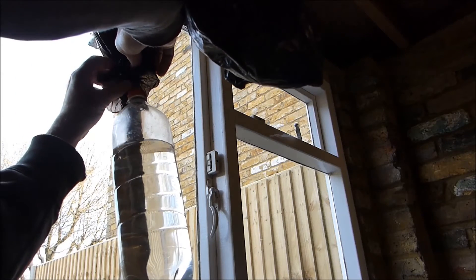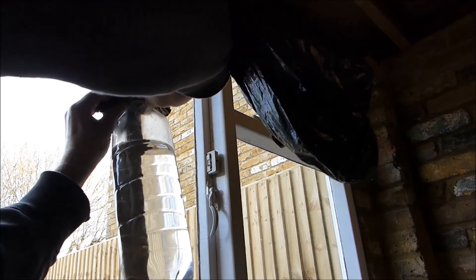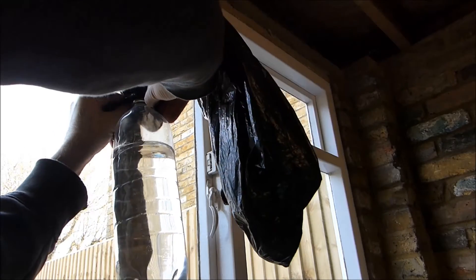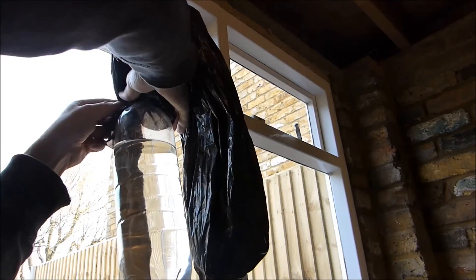Once the storage bottle is full, the excess hydrogen bubbles up through the top expansion bottle. And we can collect it by securing a 40 liter trash bag to the lid with an elastic band.